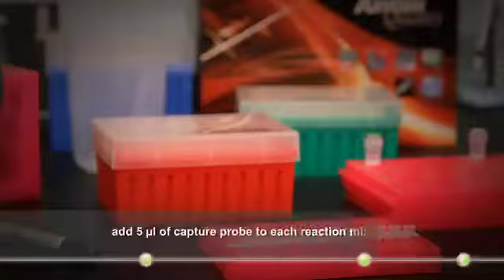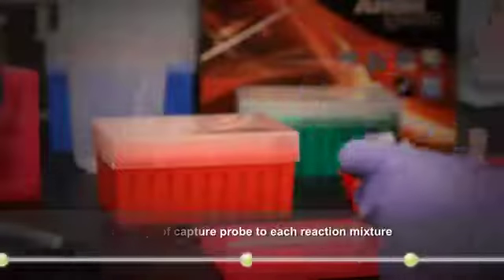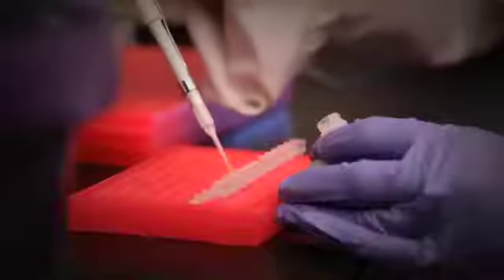The very last step in setting up your n-counter hybridization is to add 5 microliters of capture probe to each one of the tubes that you have sample in. It is important to add the capture probe last, just before the tubes go into the hybridization temperature, to ensure there are no complexes which form non-specifically which can lead to a greatly increased background.